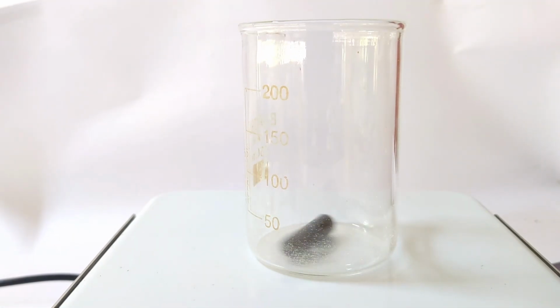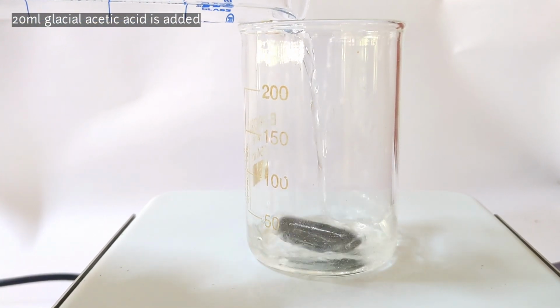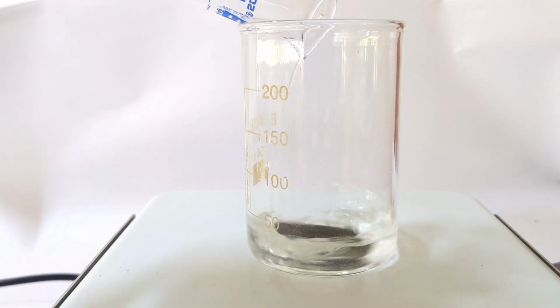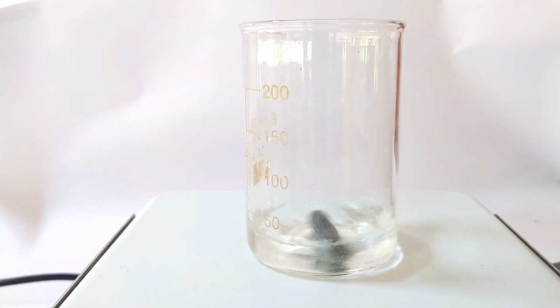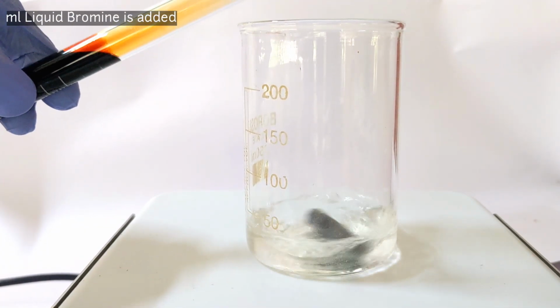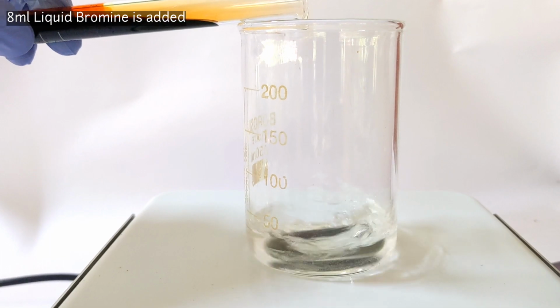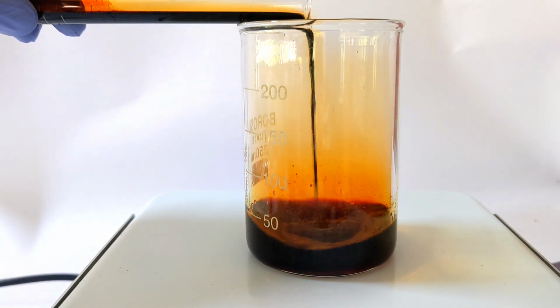Next we prepare a mixture of bromine in glacial acetic acid. For that we place a 250 ml beaker on the magnetic stirrer with the stirring bar inside and add 20 ml of glacial acetic acid. Next, 8 ml of liquid bromine was carefully added to it. This dissolves the bromine in acetic acid.